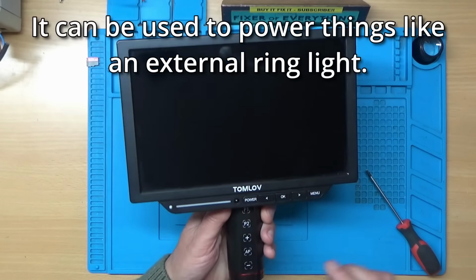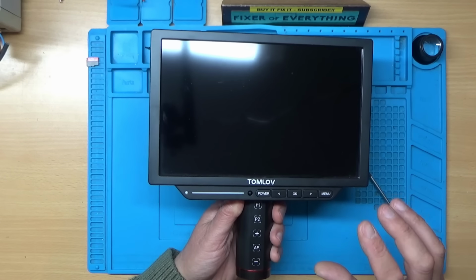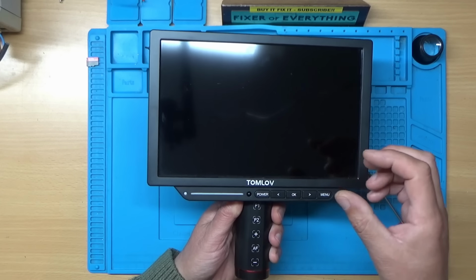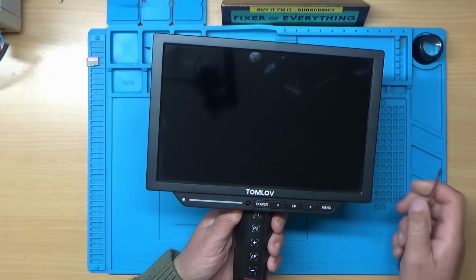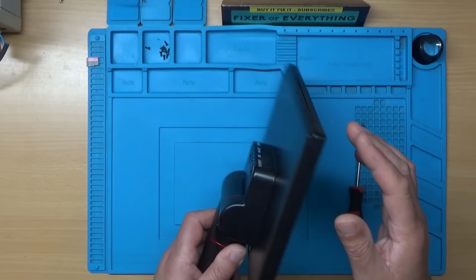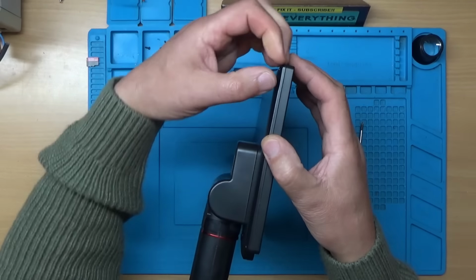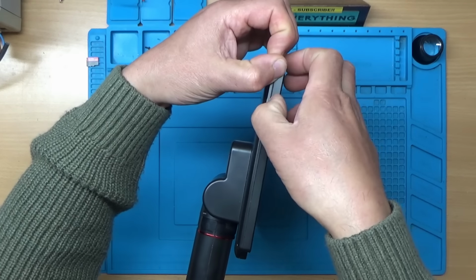But one thing that I do like about this is the auto focus function. You just hit that and it automatically focuses in, whereas with all the other microscopes that I've used in the past you've got to manually focus in. So I like that feature really a lot. Right, let's see how this comes apart then. I guess I'm going to have to take this front bezel off.